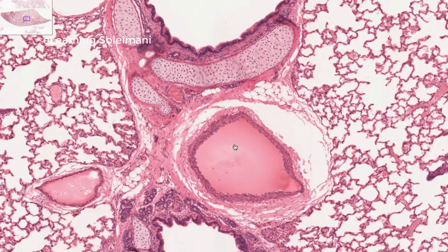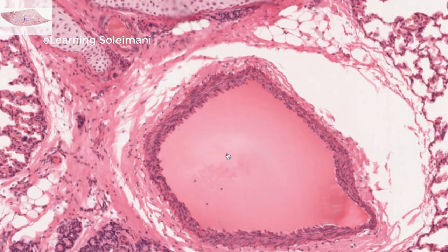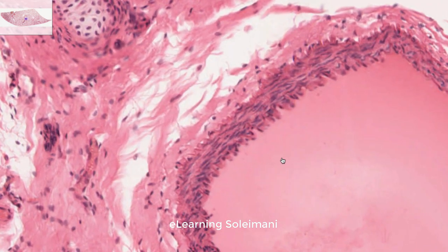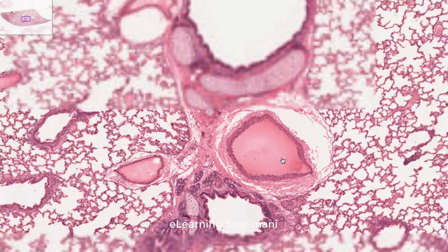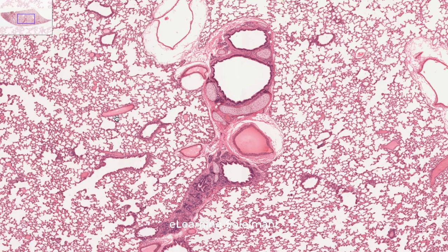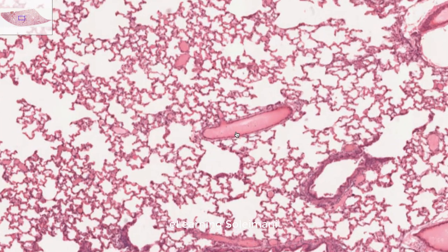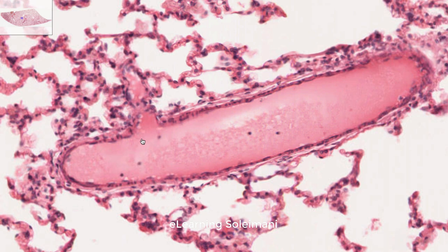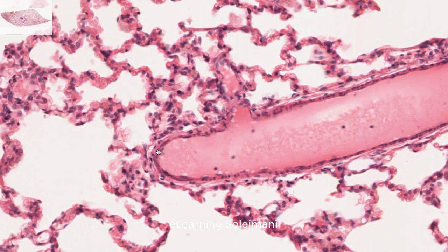These vessels arise from the thoracic descending aorta and carry oxygenated blood to the tissue comprising the bronchi and bronchioles. These arteries are quite a bit smaller than pulmonary arteries and for their size have relatively thick walls. Large thin-walled pulmonary veins are found at the periphery of the lobules at some distance from bronchi and bronchioles. These veins drain the intrapulmonary circulation and carry oxygenated blood.